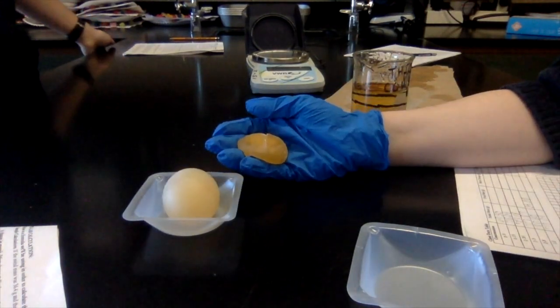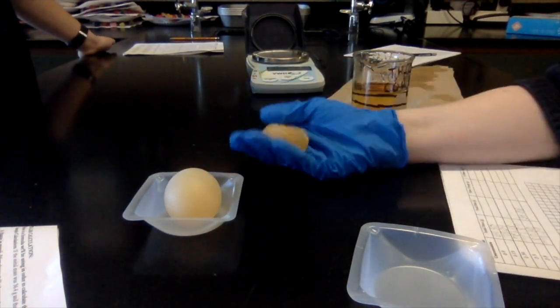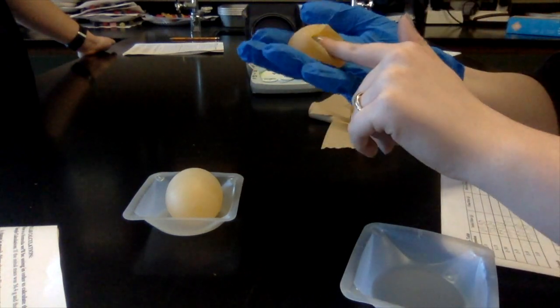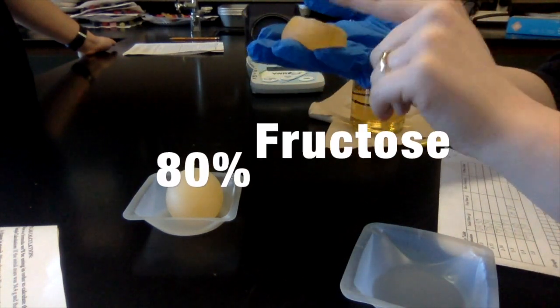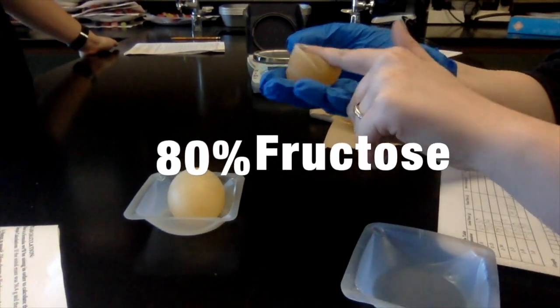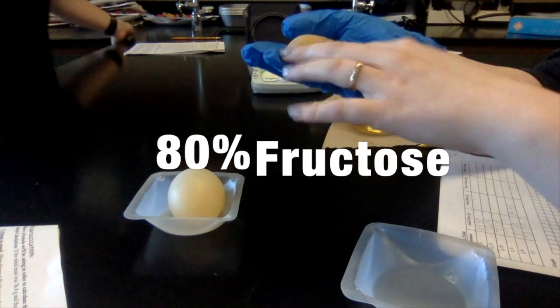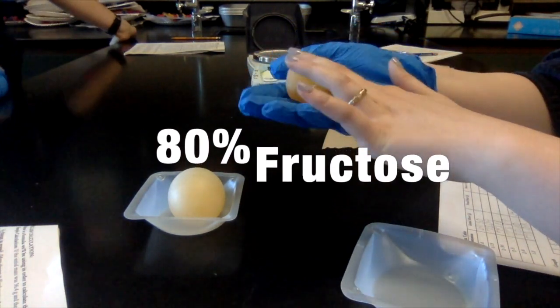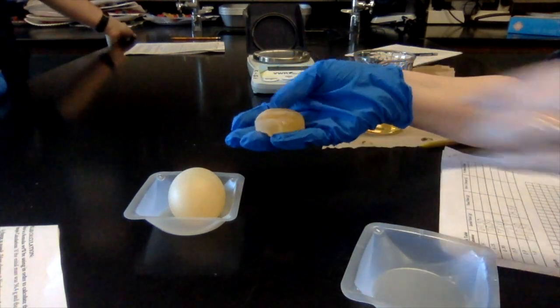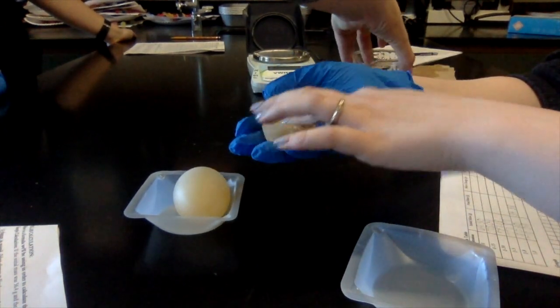Thank you. And then we're going to compare before and after. You want to talk about that? Yeah. So this egg is really saggy, there's no real water in it. And it dropped 45 grams from the original weight that it was. So it's definitely a big change in size as well. It got a lot smaller. This is very firm. This is not so firm.